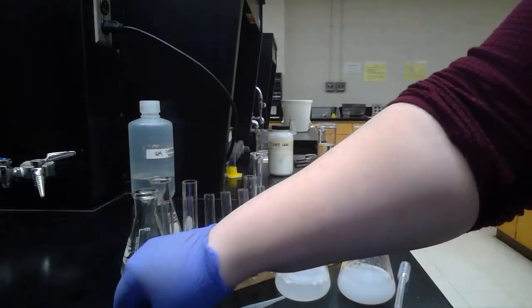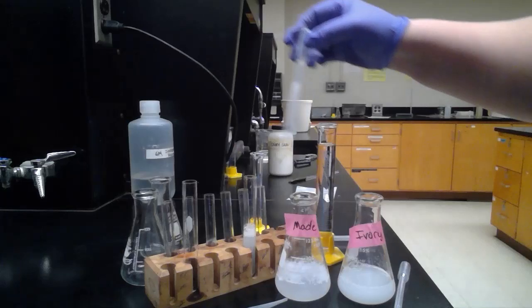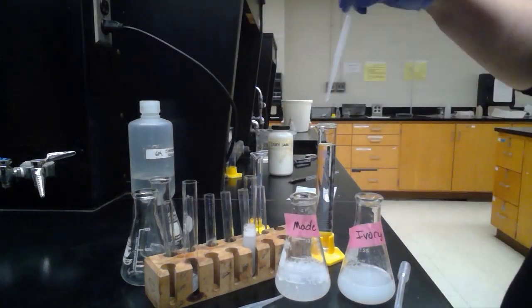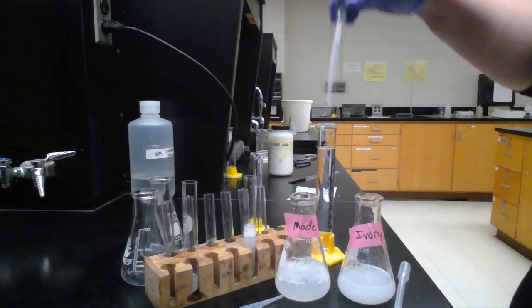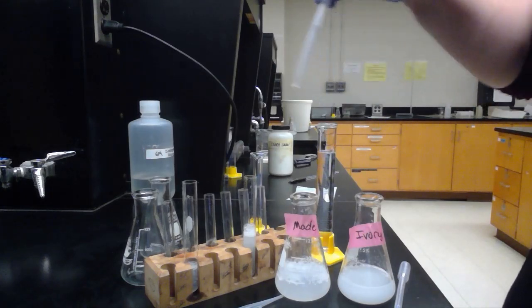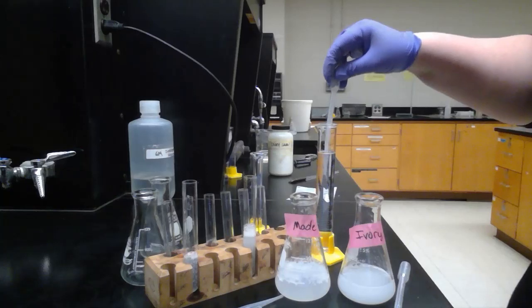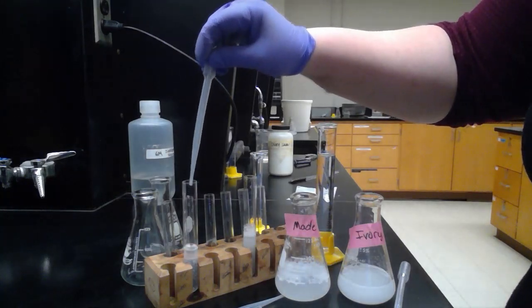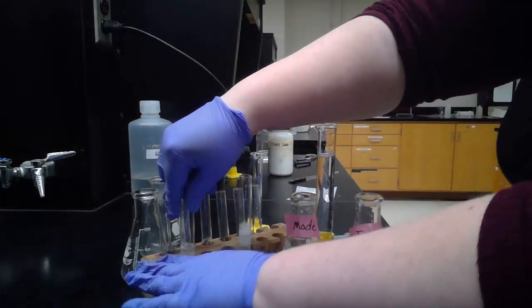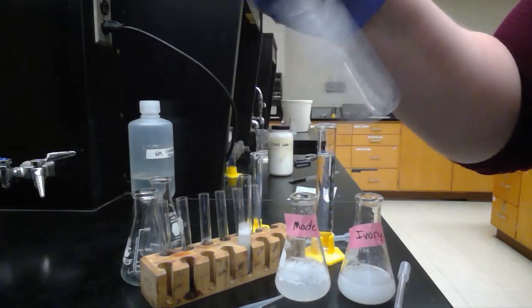Now I'm going to do the exact same thing with the made soap that we have. I'm going to take one full pipette of the soap that we made, that solution, and then again, three pipettes full of regular DI water.